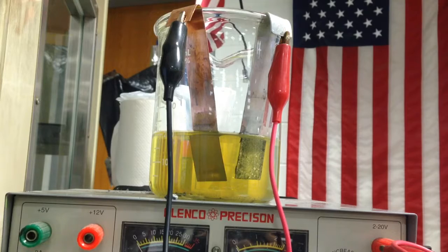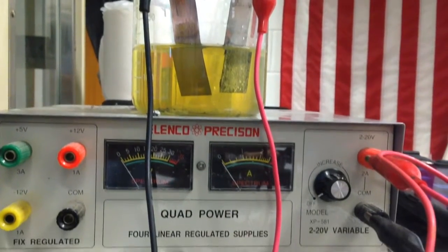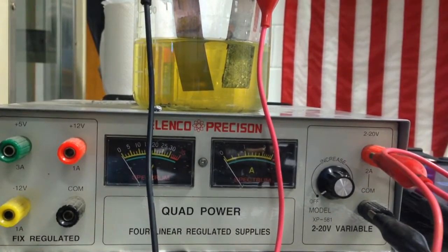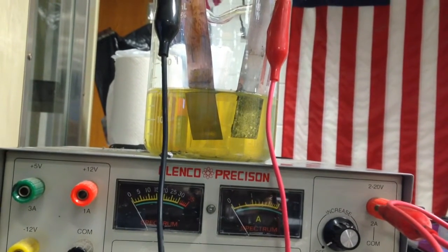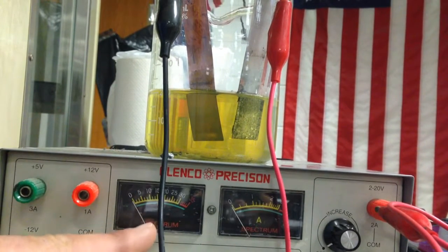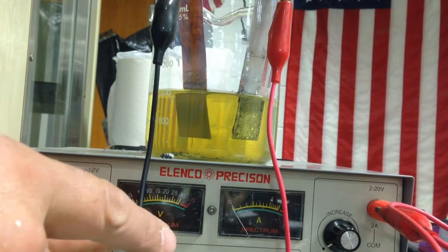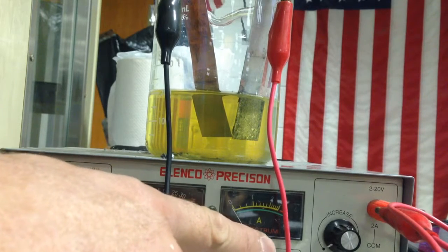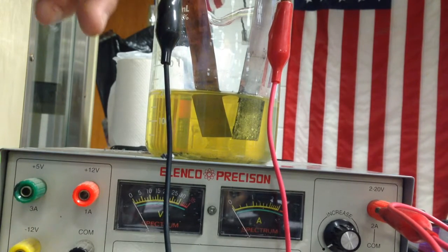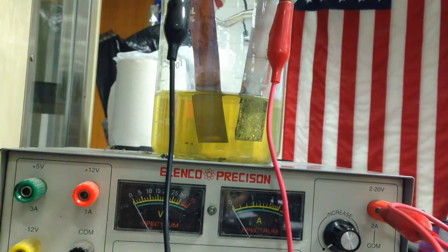And what I have below right here is a DC source. In this DC source, I'm going to add a voltage and an amperage. We should know the difference. Our voltage, and here's our voltmeter, is the energy per charge that the DC source is going to give us. And then I have the amperage here, and that's going to be the flow of charge.